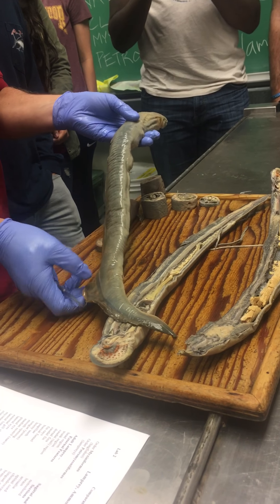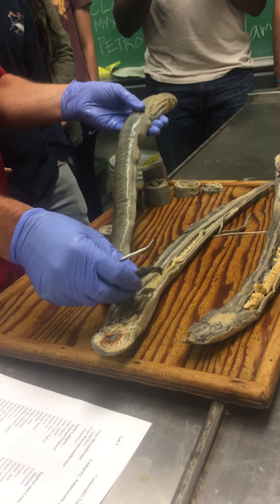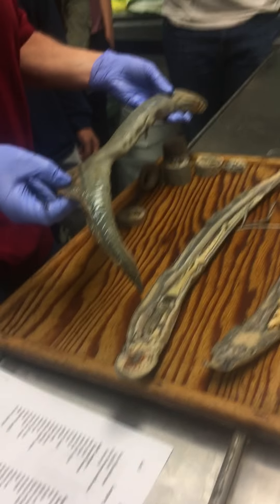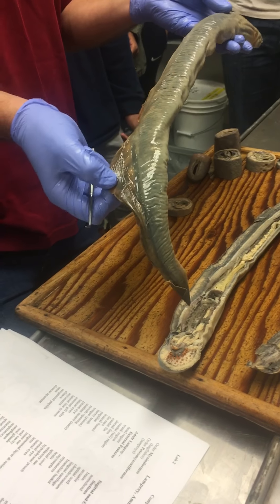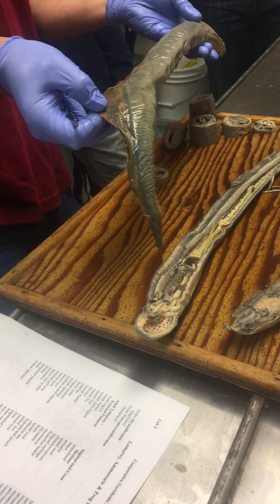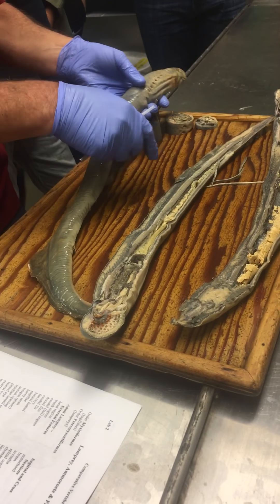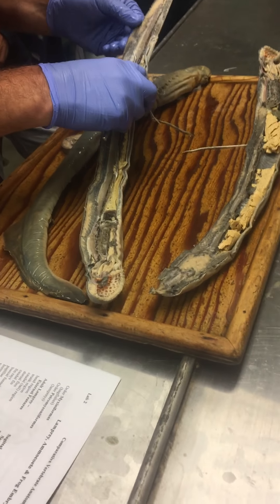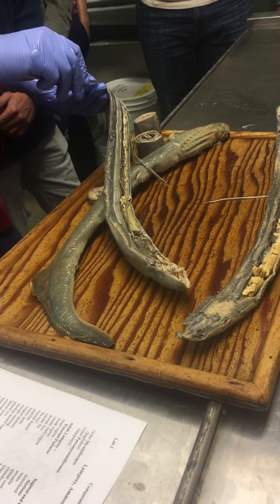There are dorsal fins and a caudal fin. The fin rays are not easy to see, but if you look here you can see little ridges in the fin and there's connective tissue supports for the fin rays. Sometimes you get a nice slice that will actually show you the fin rays a little bit better.